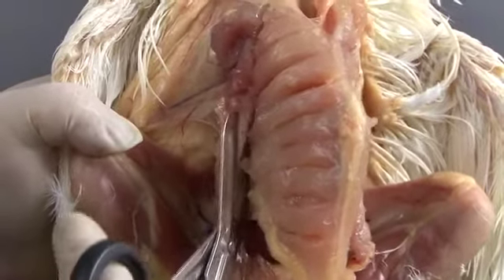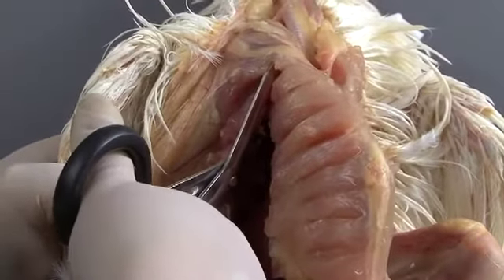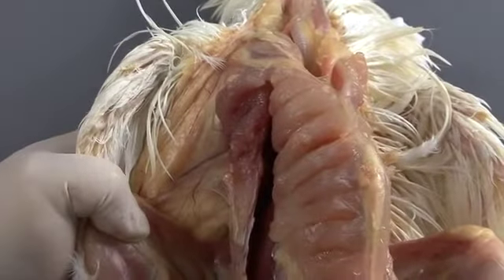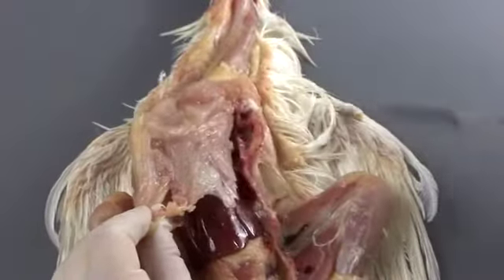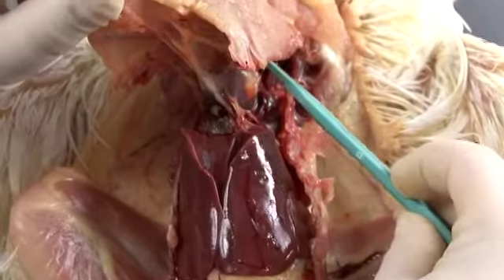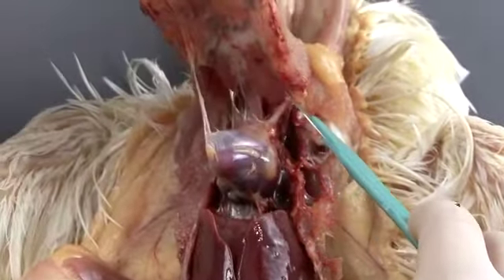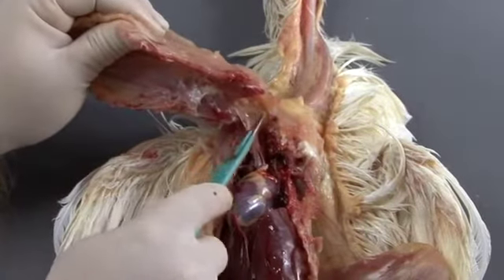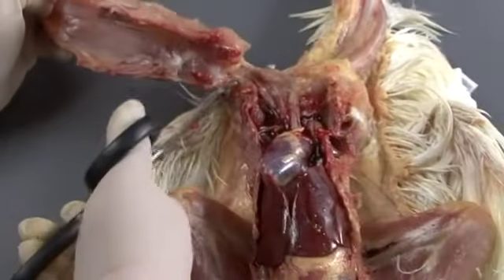Then insert the poultry shears under the ribs and cut along the costochondral junctions, moving from bottom to top. At the thoracic inlet, turn the shears medially and cut the coracoid and furcula. Lift the keel and cut any remaining soft tissue attachments over the heart. As you remove the rib plate and keel, be careful to avoid tearing the crop. When done correctly, this technique produces good tissue exposure while minimizing any tissue damage.